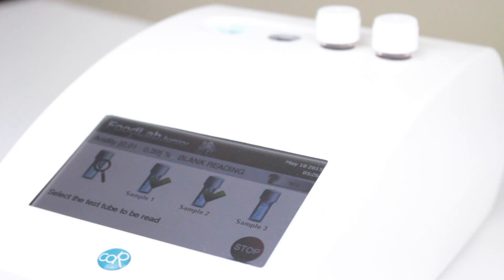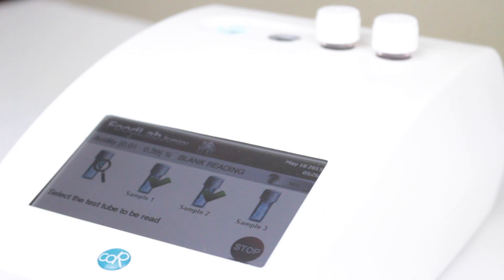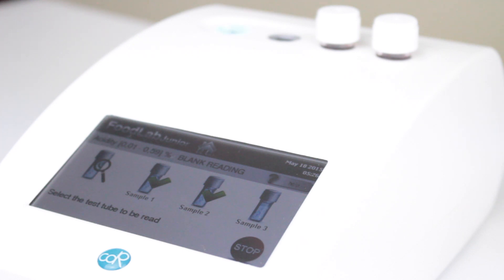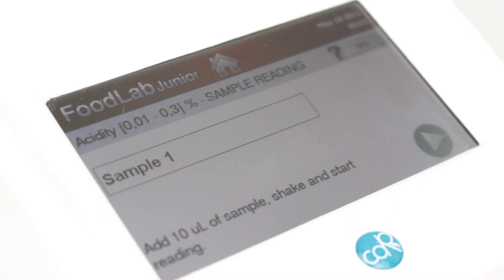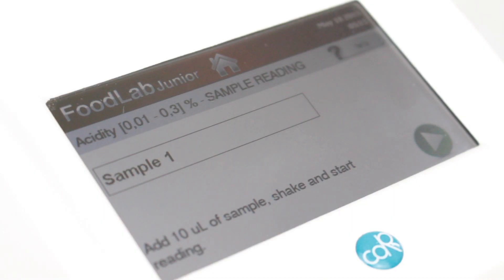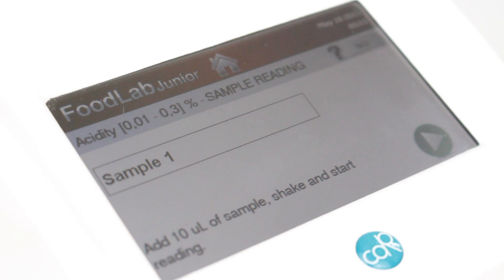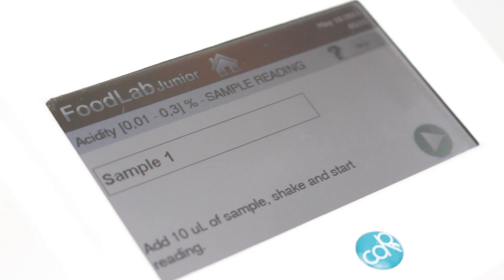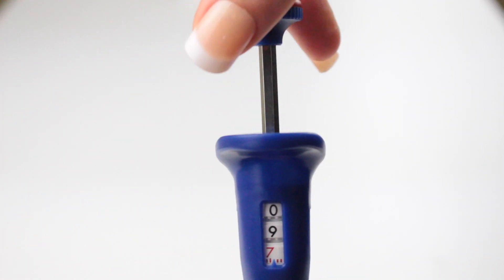Again, if you'd like to continue with a third sample you're more than welcome to, but once all the blank readings are finished you'll press 'Stop.' Next is when you actually add your oil sample — on the screen it will indicate the proper amount of sample to add.